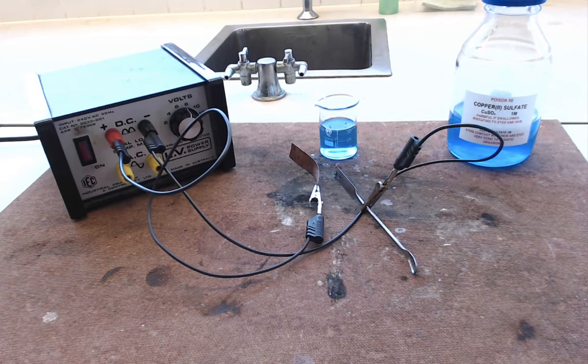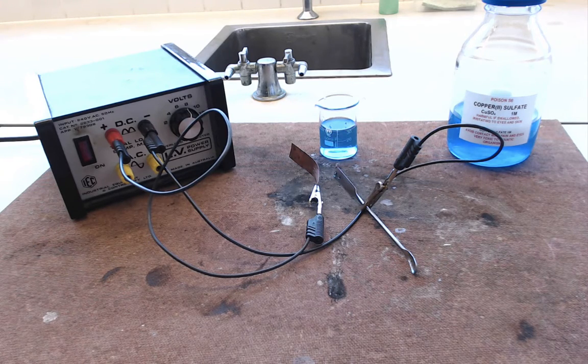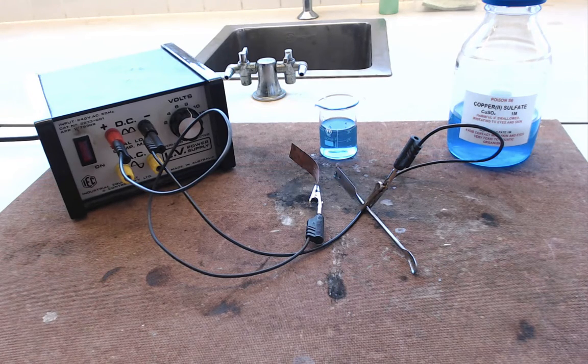And at the end of it again we're going to take it out, we're going to wipe our object clean, and we're going to see how difficult it is to scrape the copper off with our fingernail.